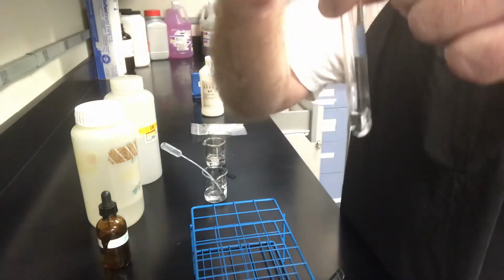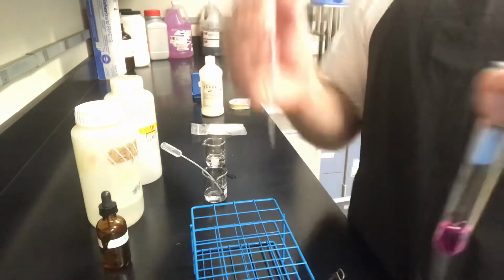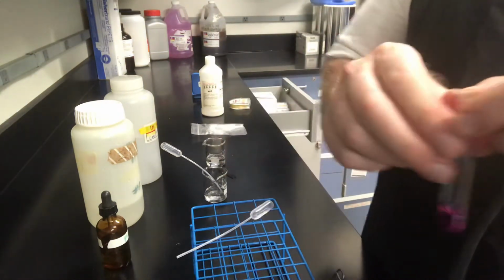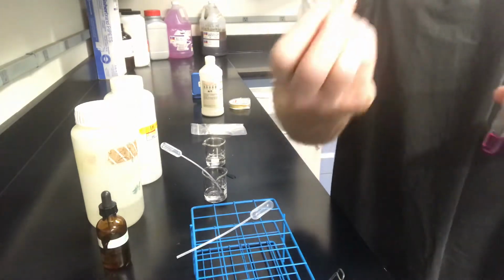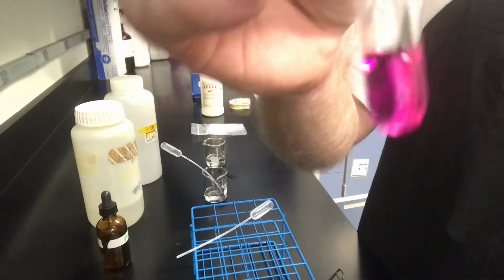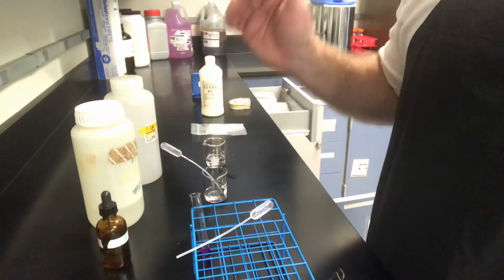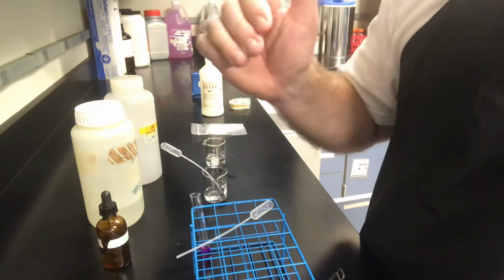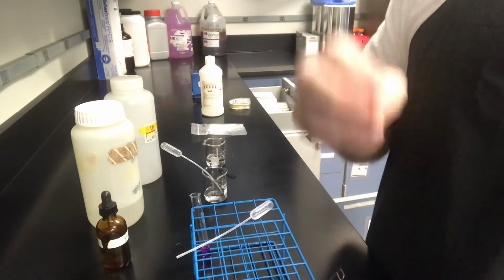So that's 25. I'm going to call it at 25, but we'll add one more just to show. Oh, that wasn't a good one. There we go. That was 26. It just flooded it with color at 26. And I knew that because at 25, we had just a small tinge of pink at the bottom of the test tube. So we're calling it a 25. The amount of drops that we added for the HCl was 10. The amount of drops that I added for the NaOH was 25.